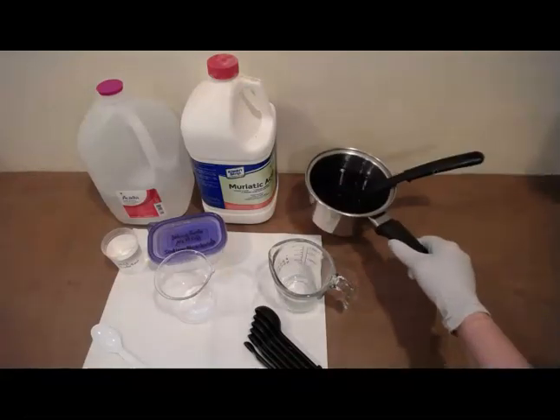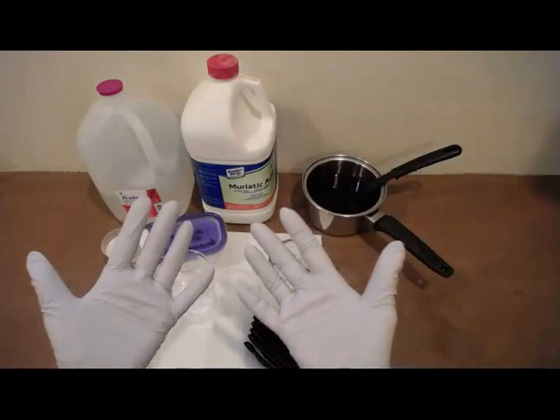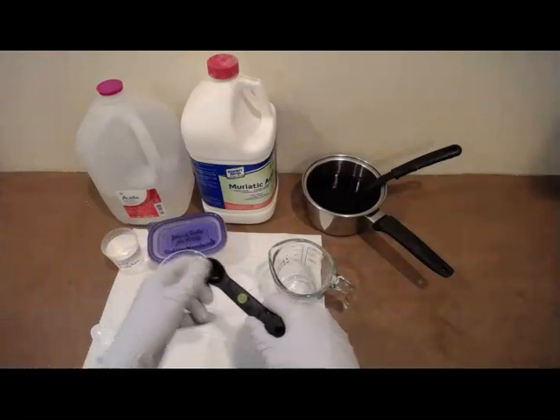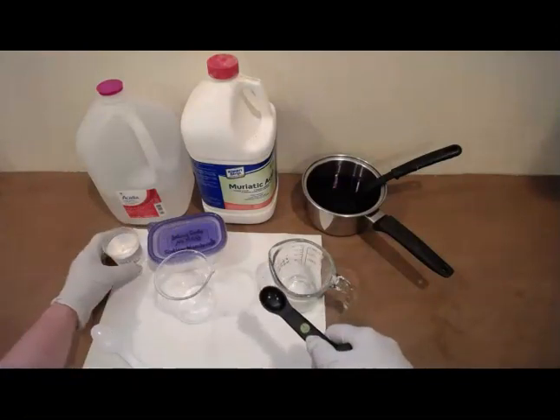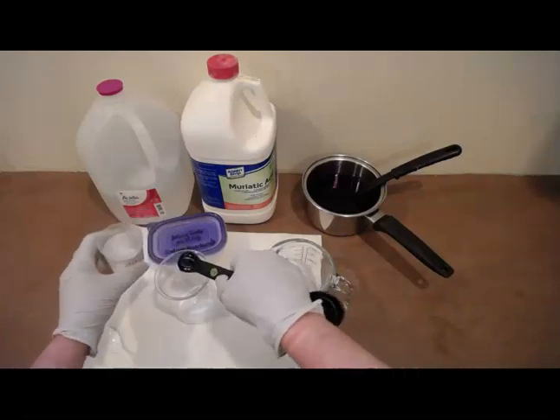Okay, so there's my pan. All right, we're going to let that cool. Step 5, add 1 teaspoon of toilet bowl cleaner to the glass. Be careful when handling the toilet bowl cleaner. If you get it in your hands, immediately rinse them with lots of water. The toilet bowl cleaner will burn skin. So remember, gloves are always the best solution to that. Hopefully you have some around. Okay, so 1 teaspoon of the toilet bowl cleaner, and we're going to add that to our beaker here.